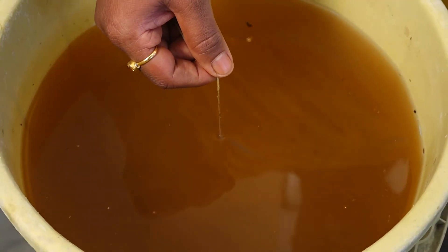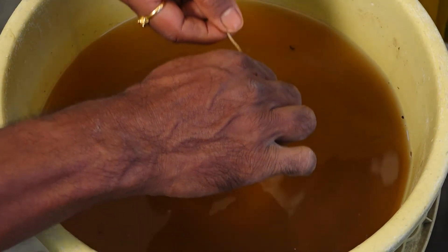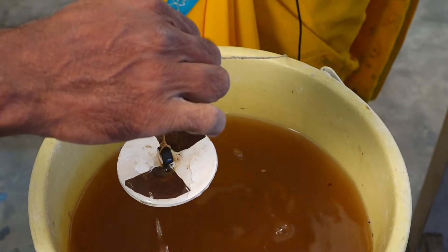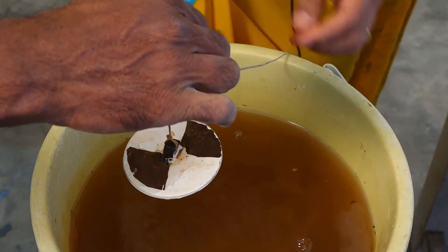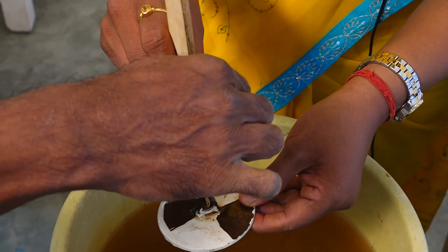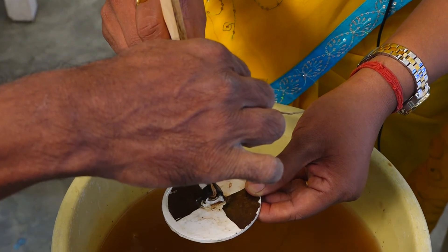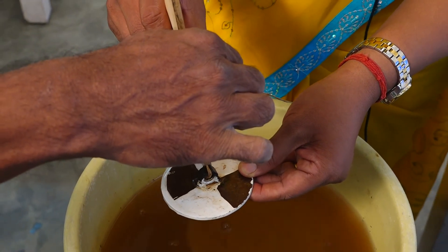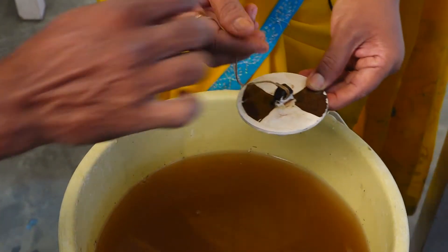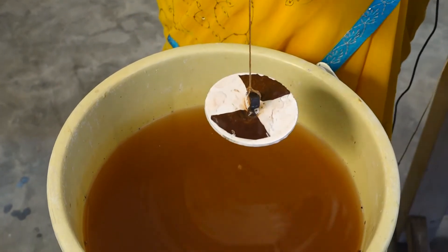I seek the help of Mr. Ganesh here. Now, taking out the Secchi disc from the water, I am going to measure the distance at which it disappears. It is 11 centimeters. So A is 11 centimeters.